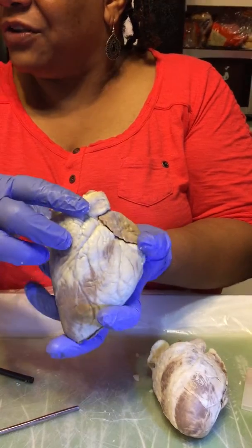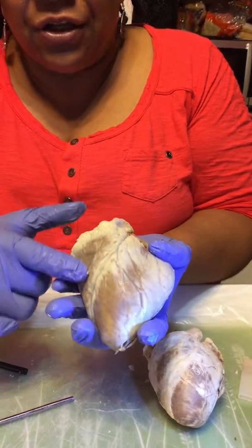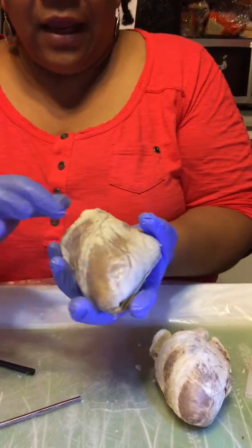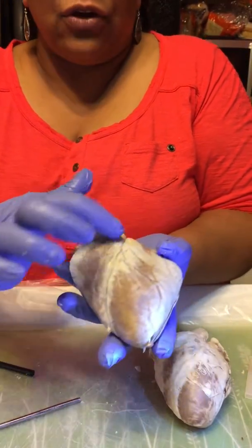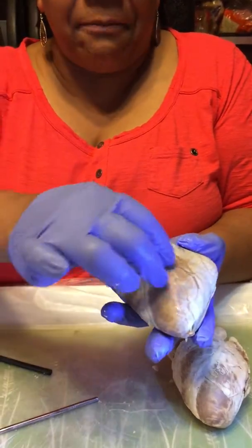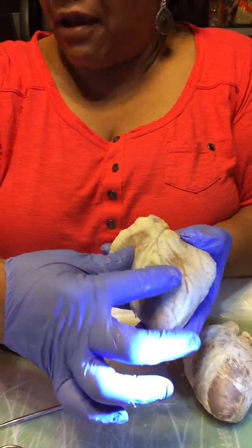And we are now going to do, as I said, the auricles. And I explained that this is the right ventricle. You can see the musculature of the right ventricle. And then here, the larger size right here is the left ventricle. And the interventricular sulcus is right here, which goes down here. This covers the coronary arteries that give the myocardium its blood supply on both sides, and it branches to the right marginal arteries, left, and so on, but that gives the blood supply to the myocardium.